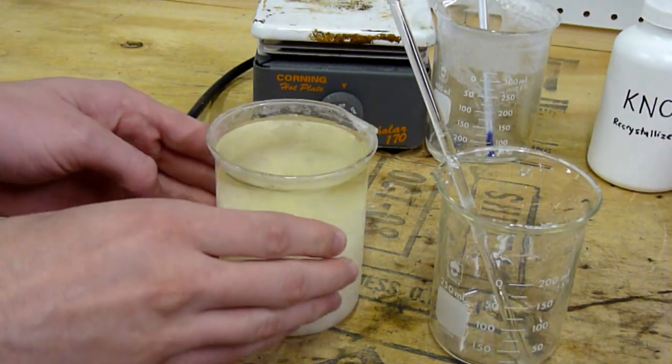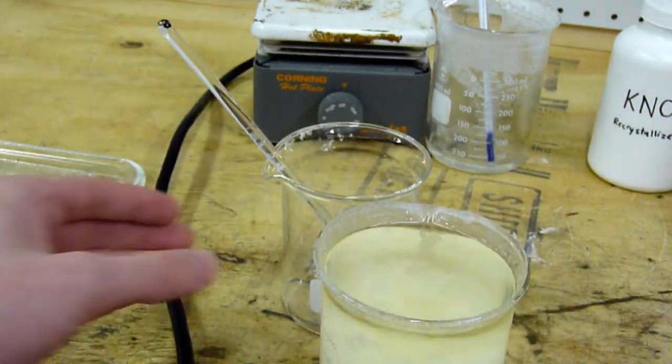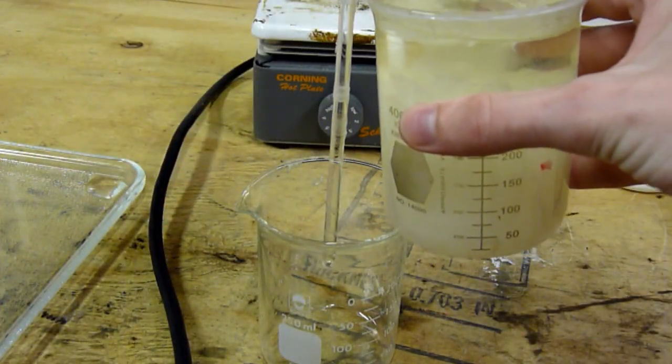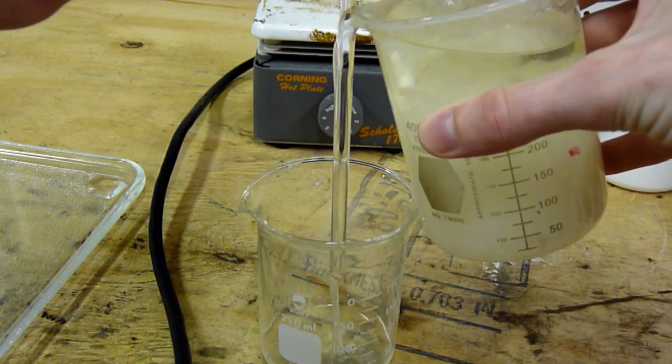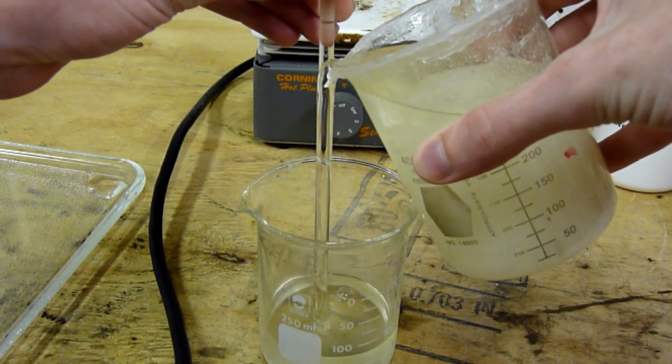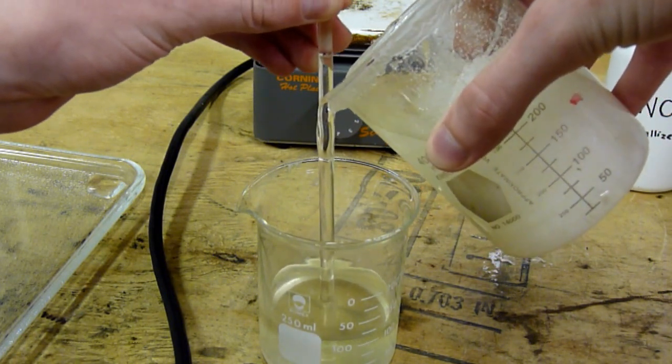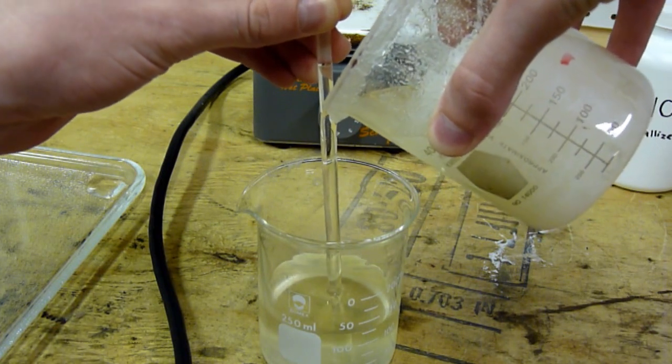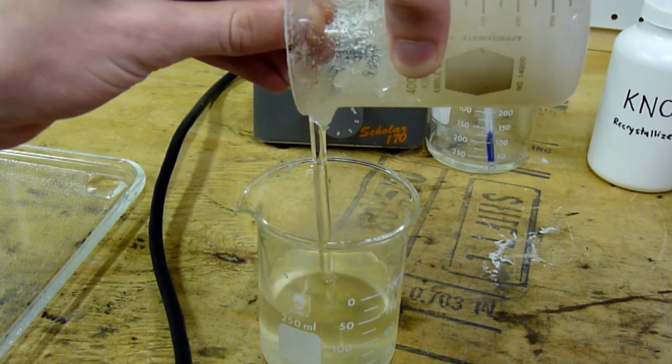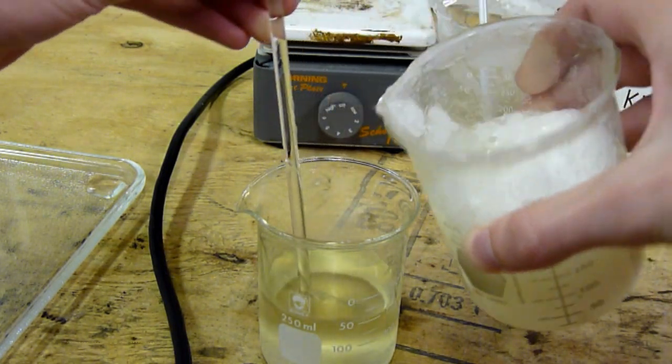And now for the decantation. As long as I get the majority of crystals I'll be fine. This is already a saturated solution, so it's going to continue to drop crystals all night. But I have to go to work, so I don't have time to sit and wait around for this. Like I said, it's lukewarm right now. And there we have some nice wet crystals of potassium nitrate.